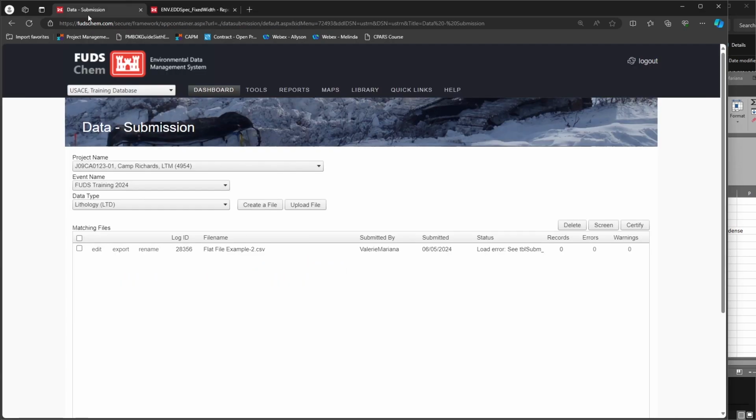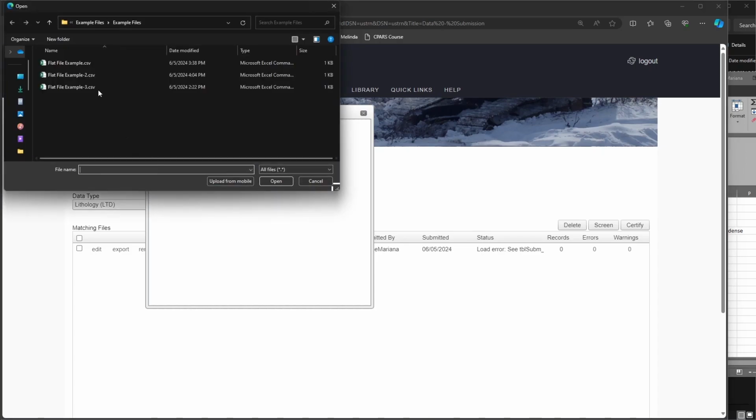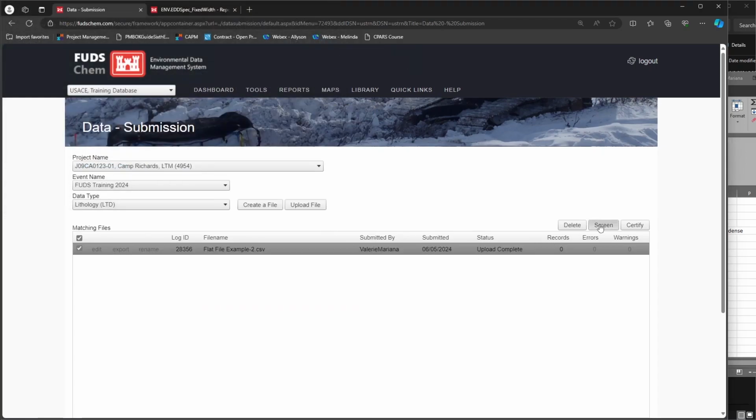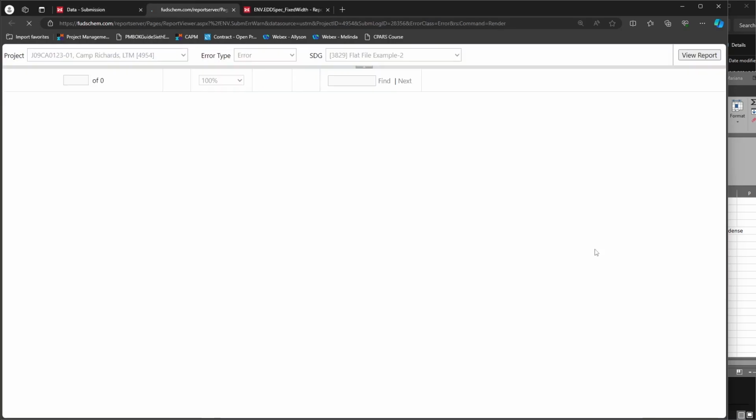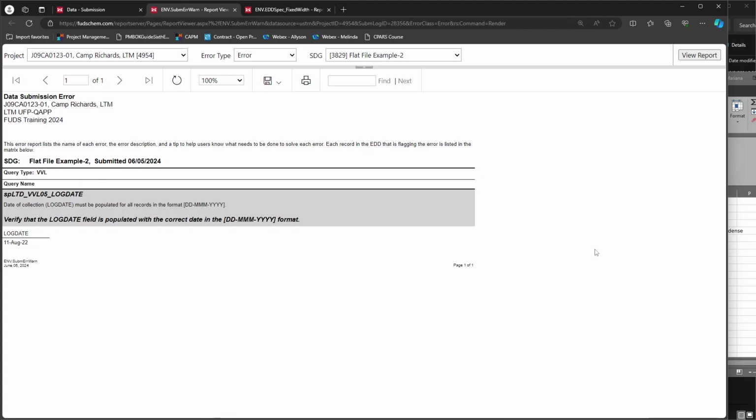Let's re-upload our file and then screen it. We can see that the file screened successfully, but there are still errors. Click on the number of errors to access the error report. Note that like our other reports, you can save this report in various formats by clicking on the floppy disk icon, or print it by clicking the printer icon. The error report will always follow the same format. The gray box includes the name and description of the error. It is followed by a tip to help you know how to resolve it. Relevant data from your file is shown below to pinpoint where the error is found.